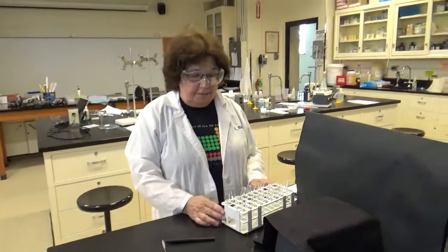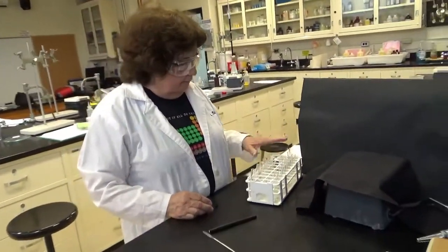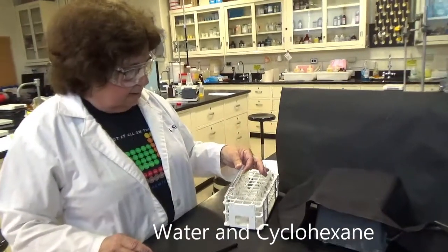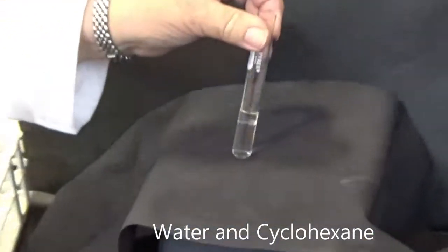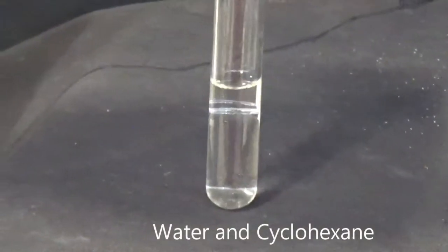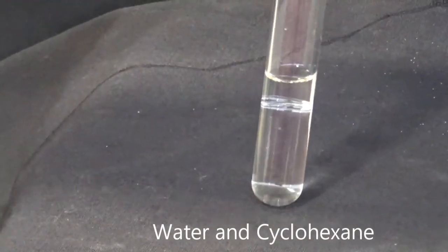Okay. So let's try the second part of the table. For the sake of time, I've added them all together. So here I added some water, and I've added cyclohexane to it. Okay, so what do you see? Do you see one layer, two layers? Do you see clear?